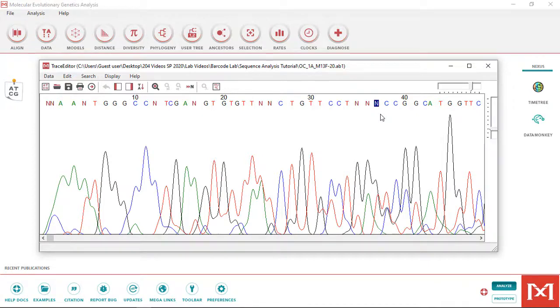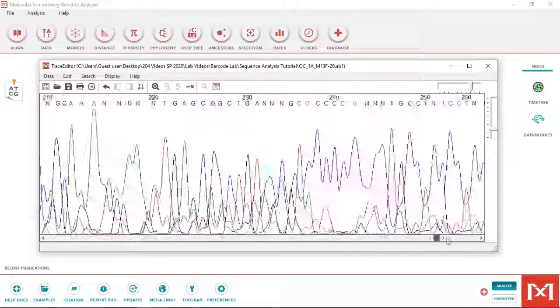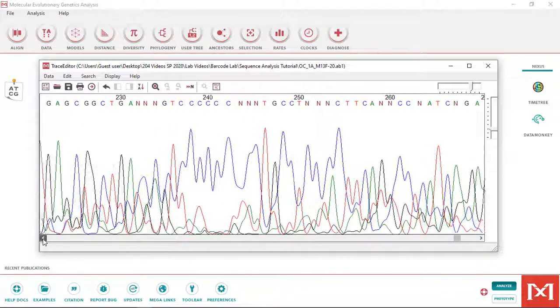So I'm going to use my cursor to highlight this N, then click the icon mask upstream of the cursor. You can also access this from the edit menu. The upstream sequence should go gray to indicate it is now masked or ignored. I'm going to do the same for the end of the sequence, but choose mask downstream of the cursor.